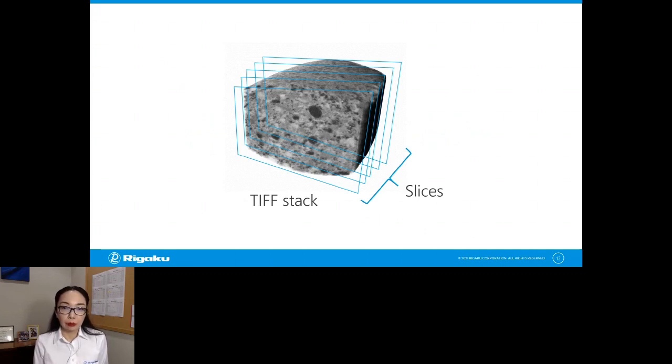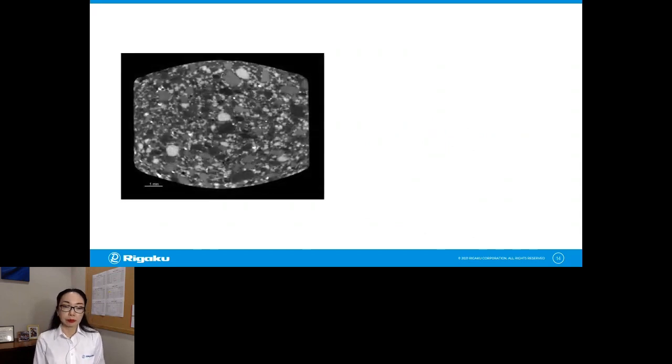And to do quantitative analysis, you would look at one slice at a time, like this one. So this is a cross section, and you see different gray levels coming from different phases. And you can categorize them as phase 1. This one is kind of light, that means it's high density. And this is phase 2, lower density, phase 3, somewhere in the middle, and so on. And in this manner, you will label all those pixels or voxels to segment this image like this.